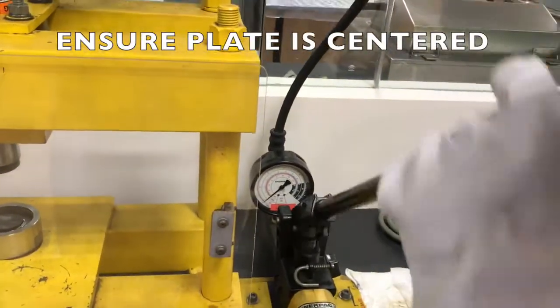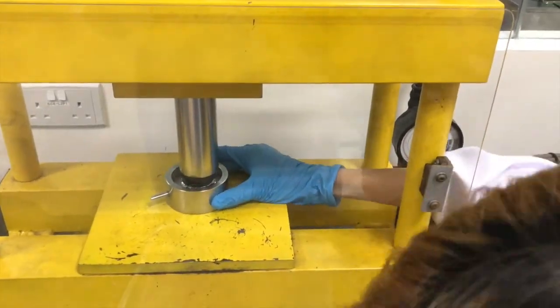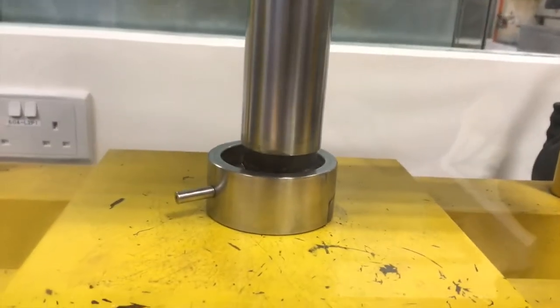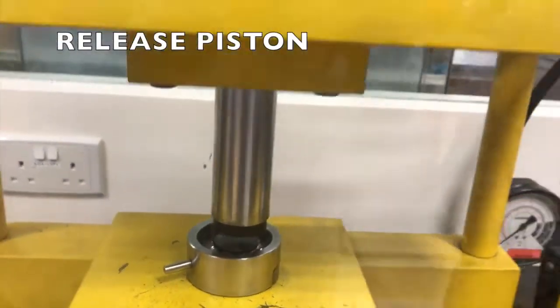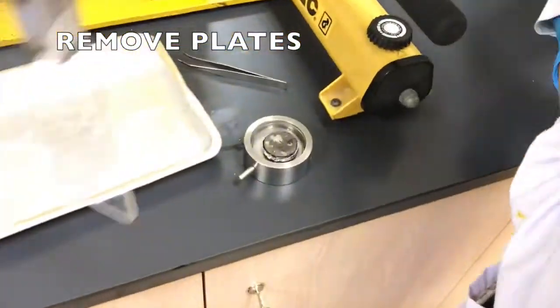Ensure that the plate is centered properly so that it will have direct contact with the metal plate. Wait for about 30 seconds as only a little pressure is needed to press the film. Release the piston afterwards, then take out the plate using a thermal glove as the metal plate is still hot.